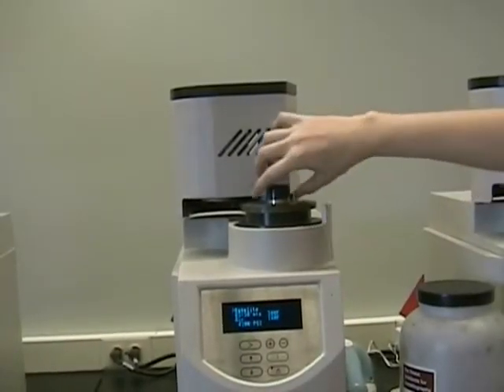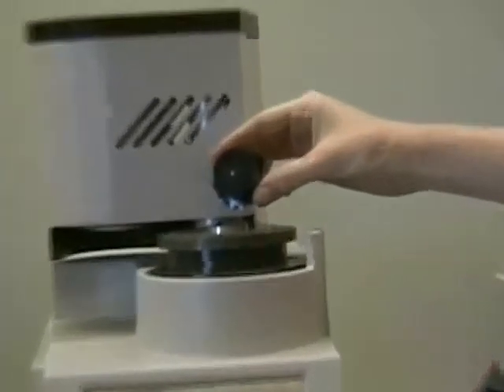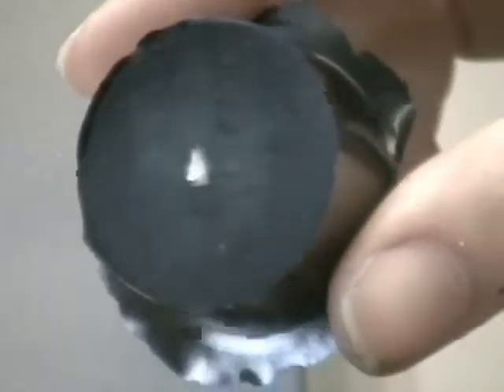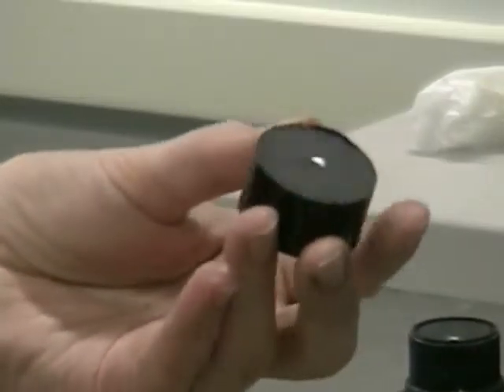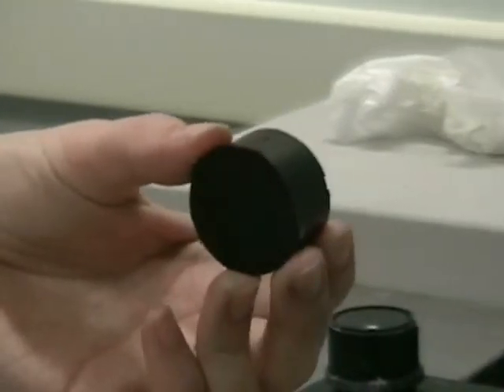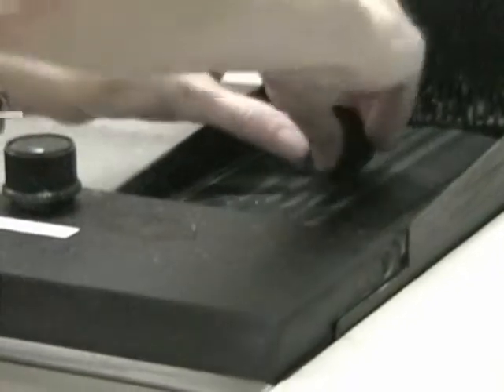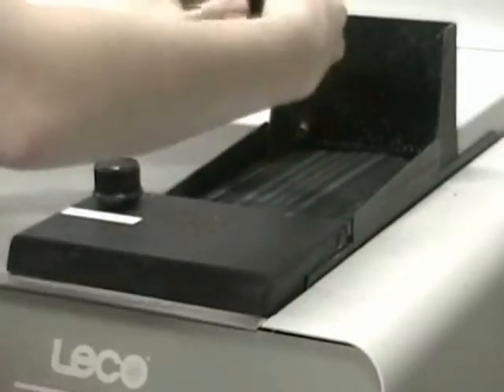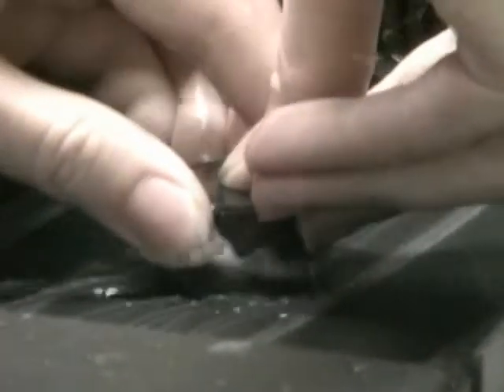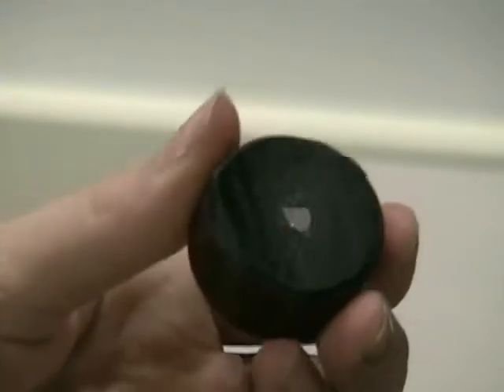Here's the sample as it comes out of the machine — it's quite hot. As you can see, our sample is partially obscured by the bakelite and the edges are somewhat sharp. So we must grind it down on the belt sander, much the same process as with the aluminum bronze ingot. Make sure you round the edges and grind off until the whole sample is exposed.